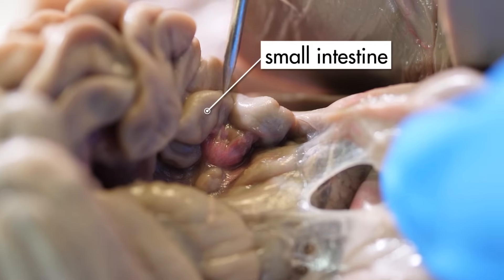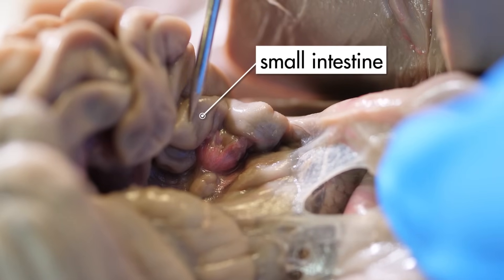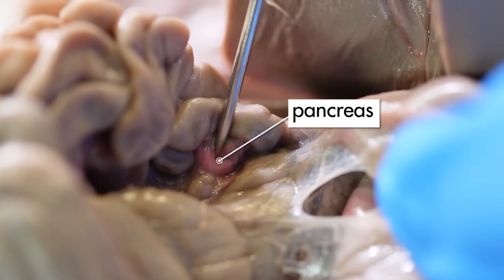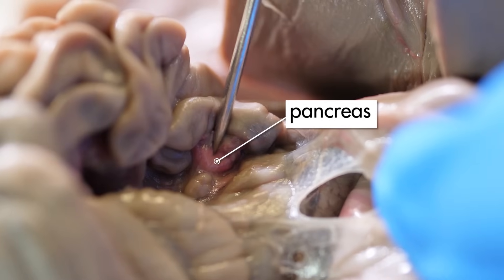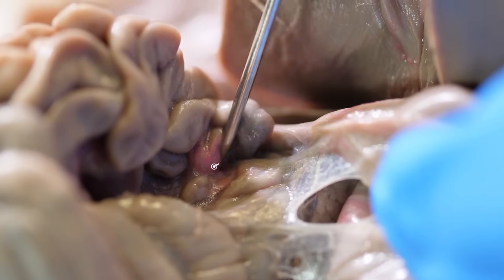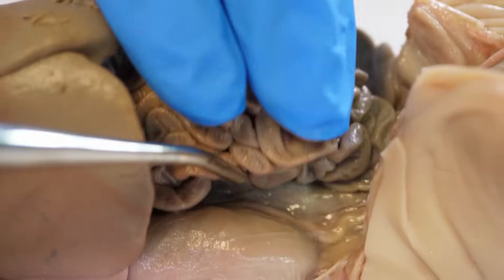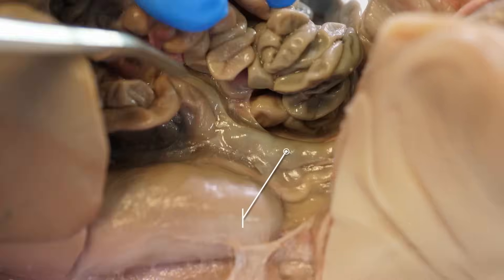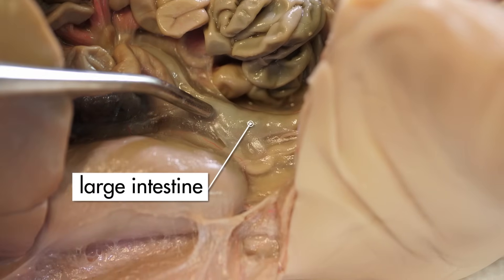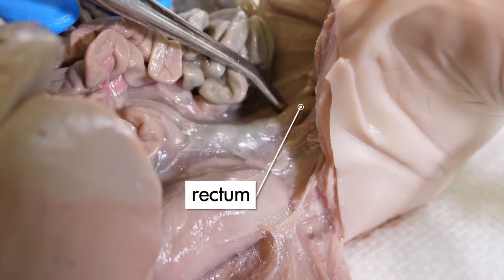The stomach connects to the small intestine. In the first curve of the small intestine, we can see the pancreas, which is a gland that aids in digestion and other metabolic processes. The small intestine winds around in the abdominal cavity until it connects to the large intestine. The large intestine ends at the rectum.